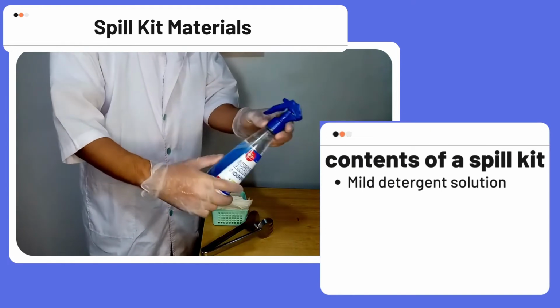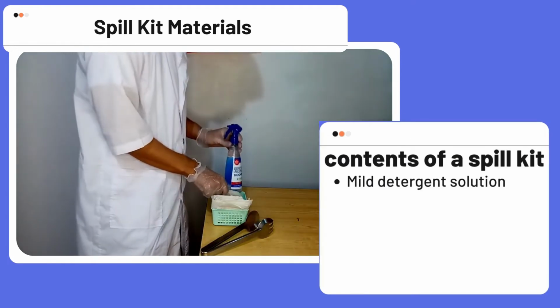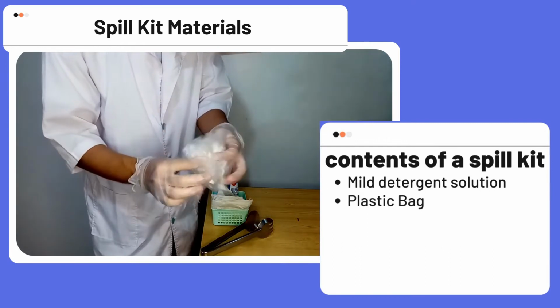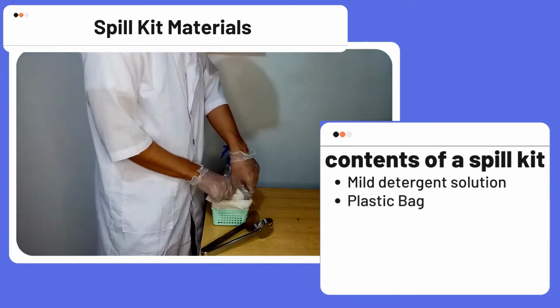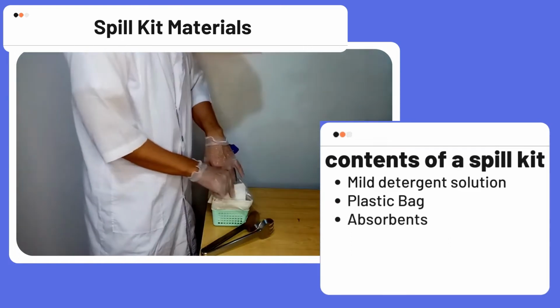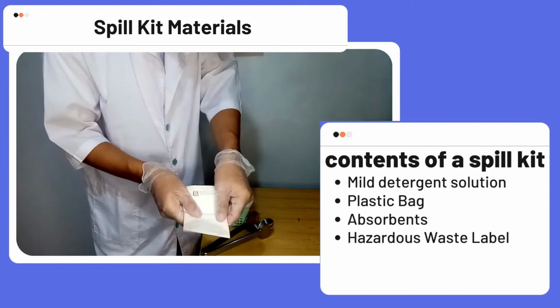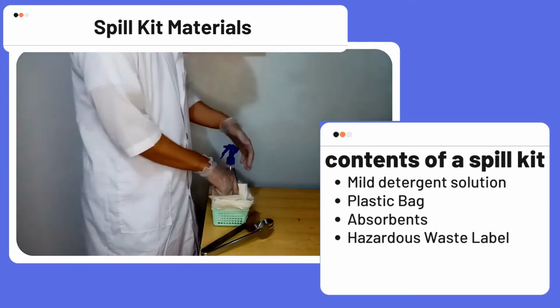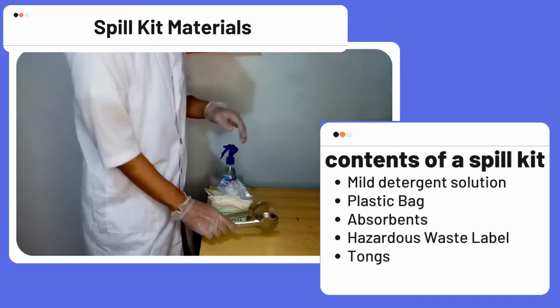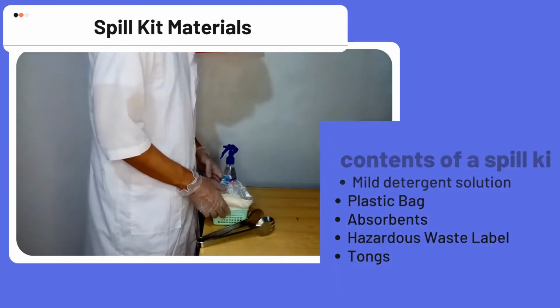The contents include a mild detergent solution, which is used to clean up the surface. Next is a plastic bag, which is used to hold the disposed contents. Next are the absorbents, which are used to absorb the chemical spill. Next is the hazardous waste label that is used for disposal. And lastly are the tongs, which are used to pick up shards of glass or other material.